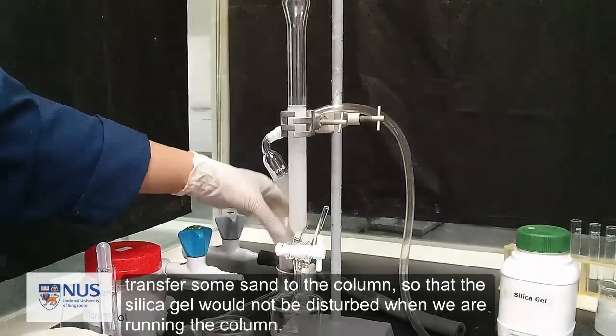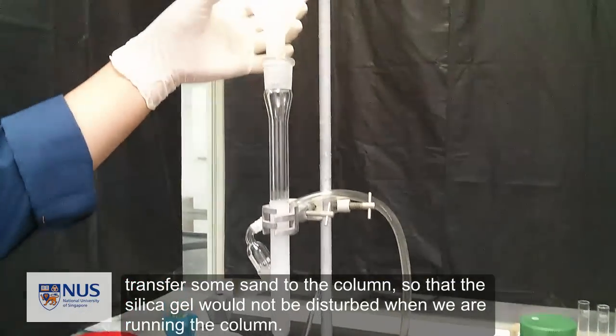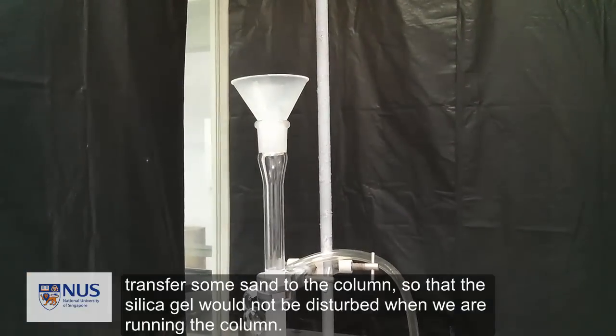transfer some sand to the column so that the silica gel would not be disturbed when we are running the column.